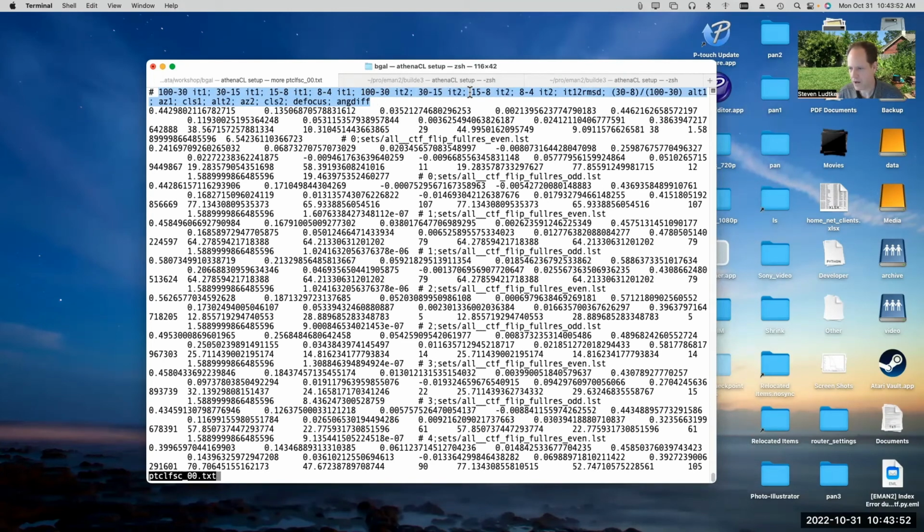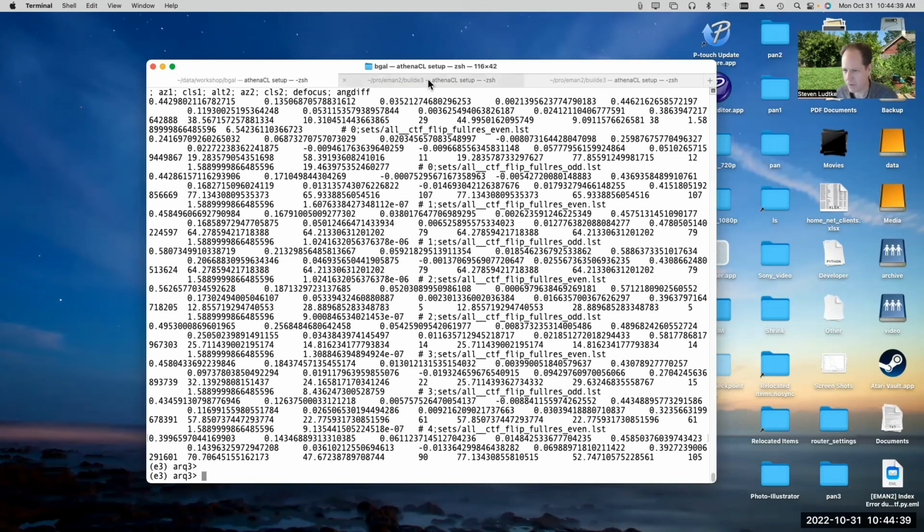So here it gives you the resolution ranges for the first iteration and the second iteration that it looked at. Then there's an RMSD between the two, which is basically the agreement, how close they are to that slope 1 line in the corresponding plot. Then we've got something comparing the intermediate resolution to the low resolution. Then we've got orientation parameters here, that sort of thing. So when it does the splitting between good and bad, I believe it uses maybe the first 3 resolution bands for both iterations. And I think it uses this RMSD parameter, which is sort of how well the 2 iterations agreed with each other. Maybe it uses that too. I'd have to look at the program. Anyway, the automatic selection of the bad particles is generally pretty good.